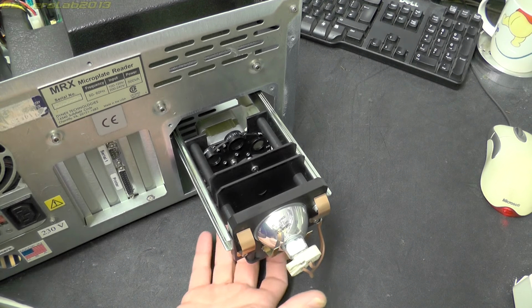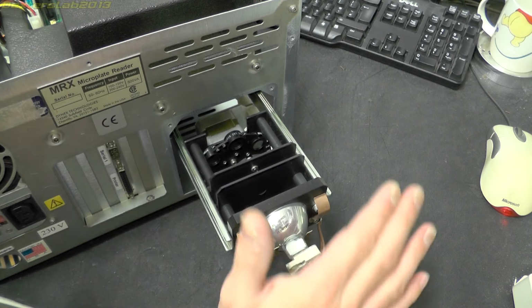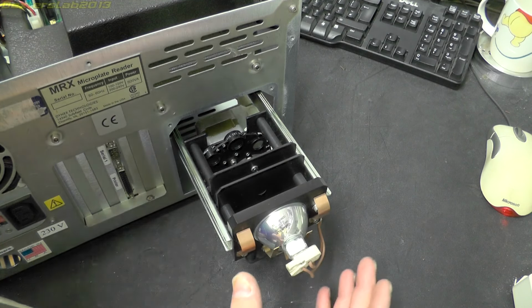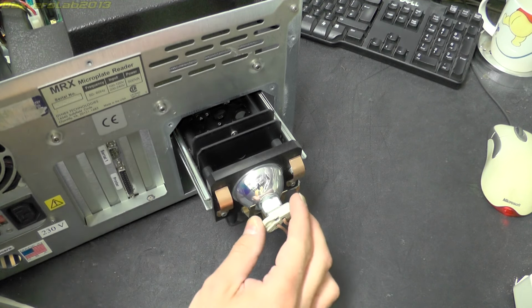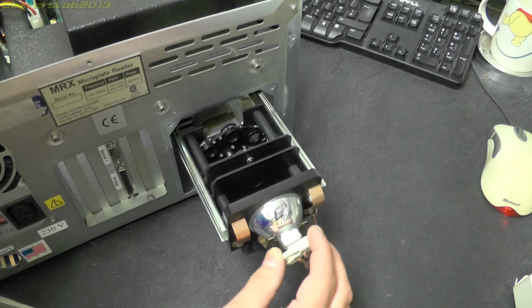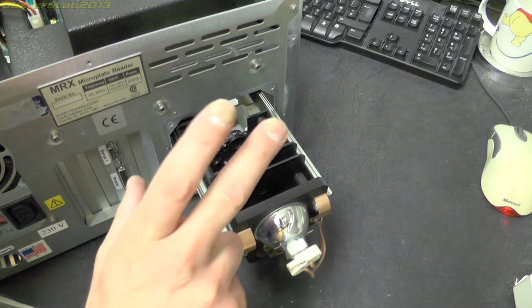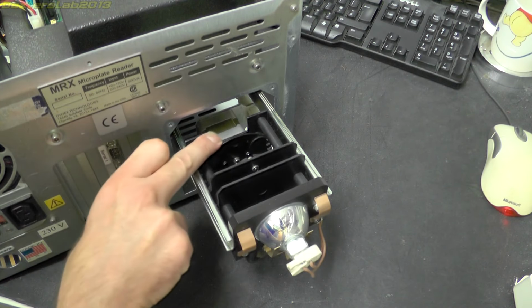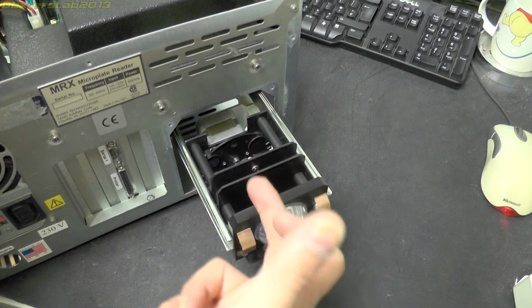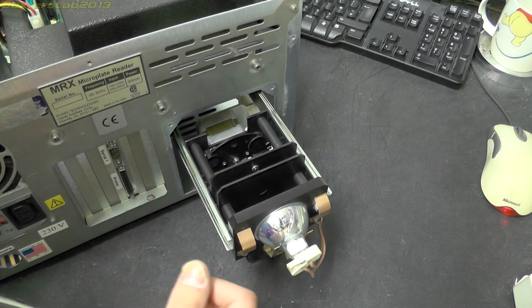Just noticed below that there is actually a cooling fan as well, just blowing up close to this light source. That is 12 volts, 75 watts. So we've got a small halogen light there, providing the light source through a mask, lens, and then these filters, and presumably the light then continues on into the machine deeper, and then sent to the microplate.